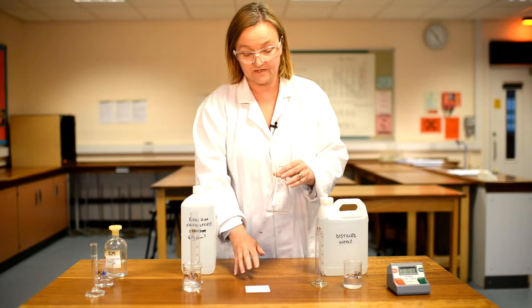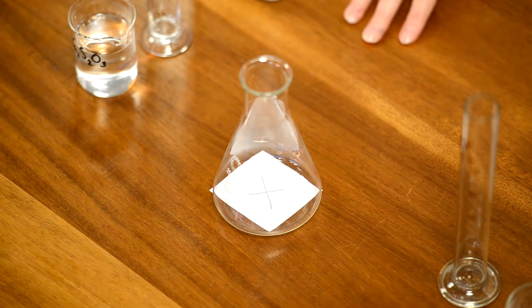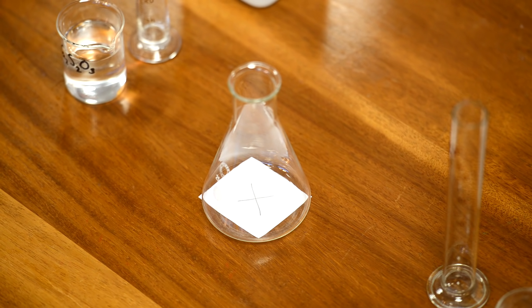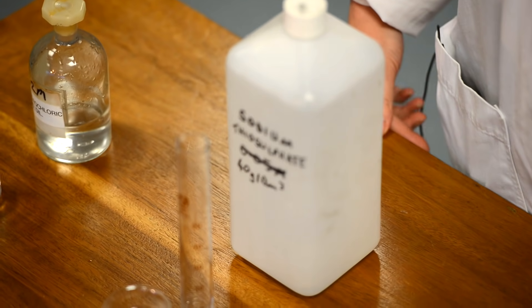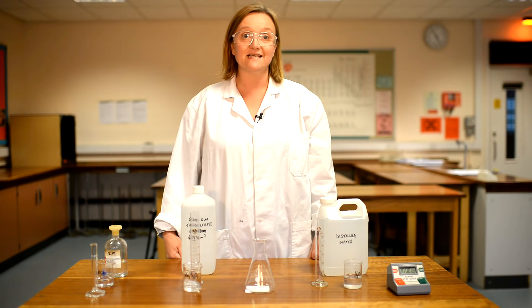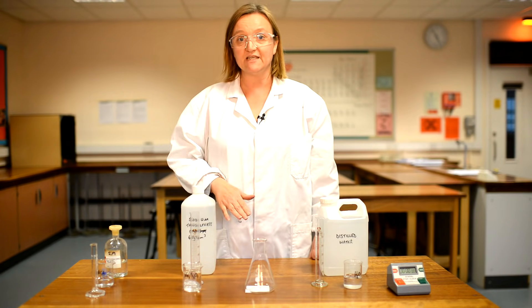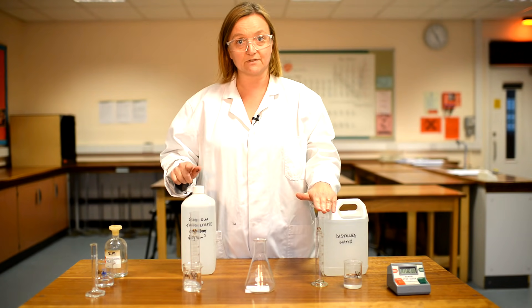The cross will go underneath the reaction vessel and we're going to mix together 50 centimetres cubed of sodium thiosulfate with 10 centimetres cubed of hydrochloric acid. We're going to vary the concentration of the sodium thiosulfate and see what effect that has on the time it takes for the precipitate to form and the cross to disappear, changing the concentration by diluting the sodium thiosulfate with distilled water.